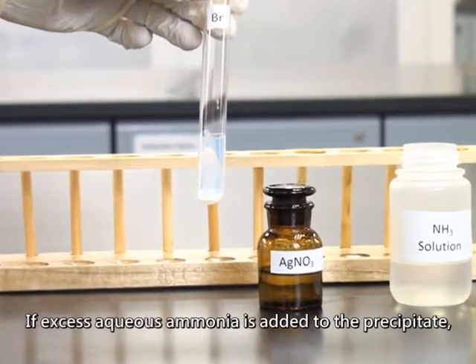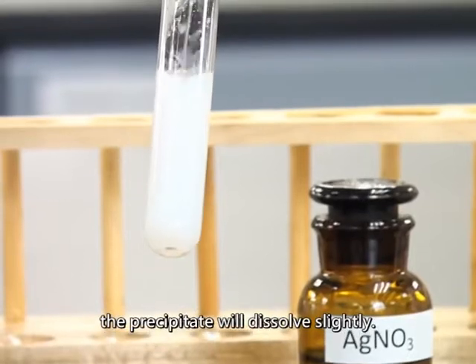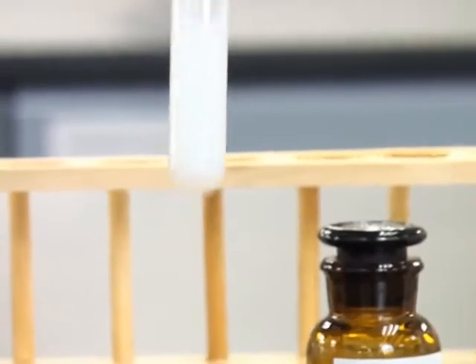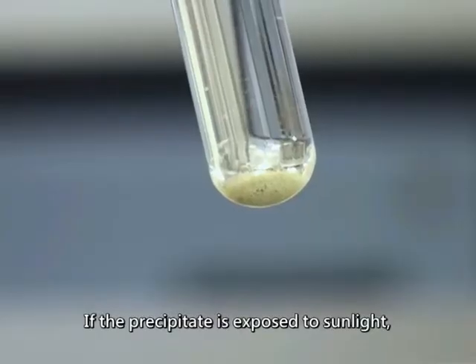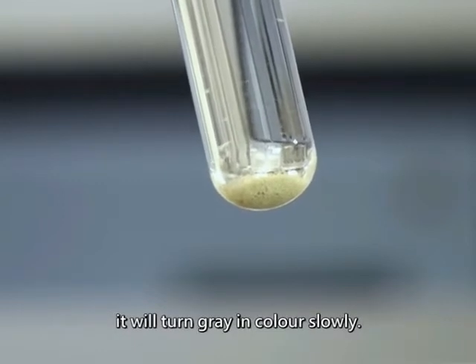If excess aqueous ammonia solution is added, the precipitate will dissolve slightly. If the precipitate is exposed to sunlight, it will turn gray in color slowly.